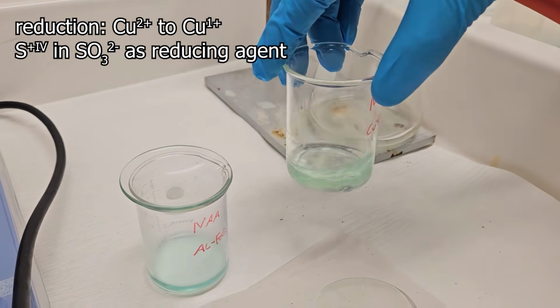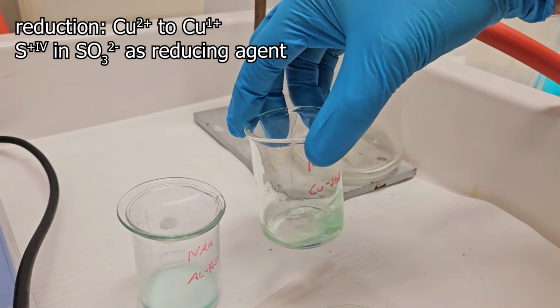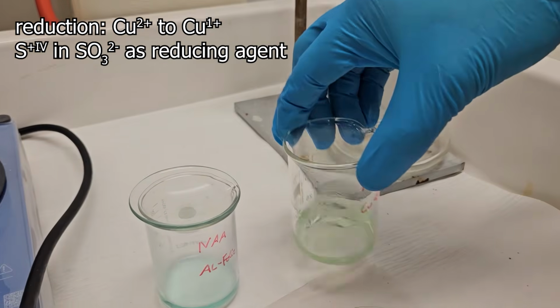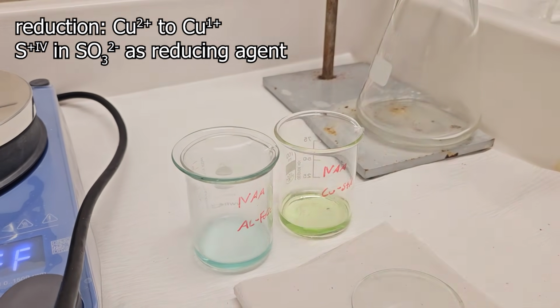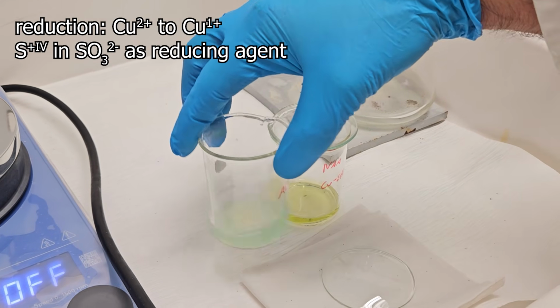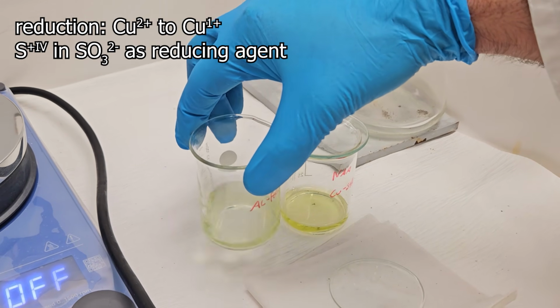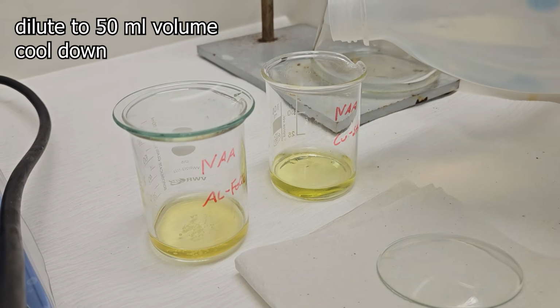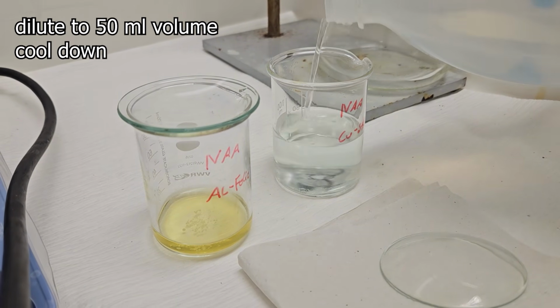Accordingly, we now add enough spatula tipfuls of sodium sulfite to reduce the currently present copper 2+ to copper 1+. Transition metal chemistry is always beautifully colorful. A yellow color tells us that the reduction is complete. The mixture is then diluted to 50 ml with distilled water and left to cool.